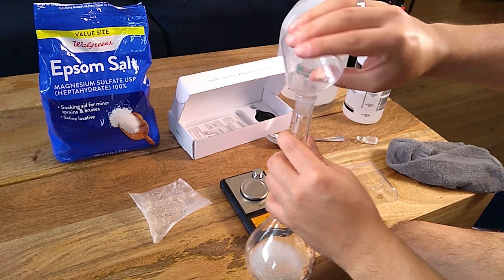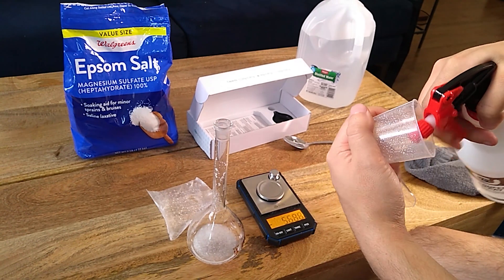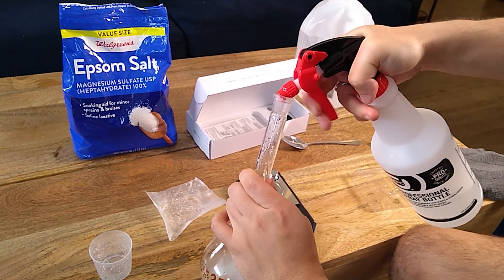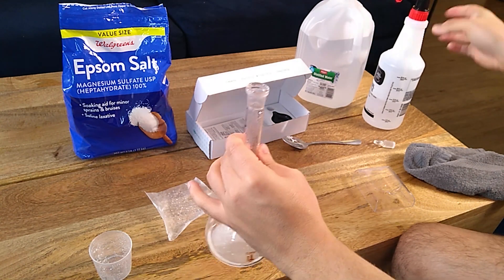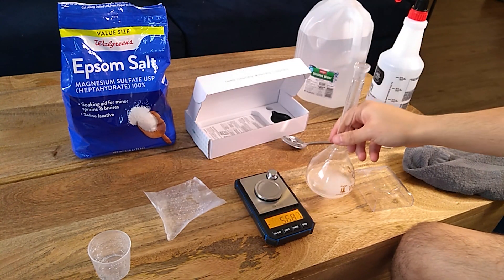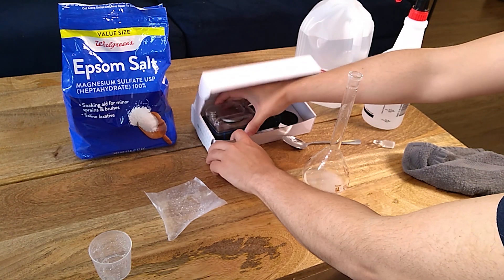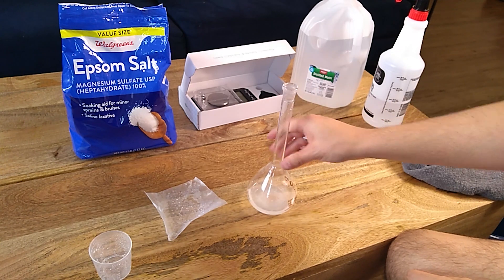I got some there. Now you also want to just wash it at the end — make sure you get all of it in there. Now I'm going to go ahead and do the rolls. Now we have all our magnesium here. It's not dissolved yet, as you can see. So we need to dissolve this before we take it to the final volume. Let's put the scale away.